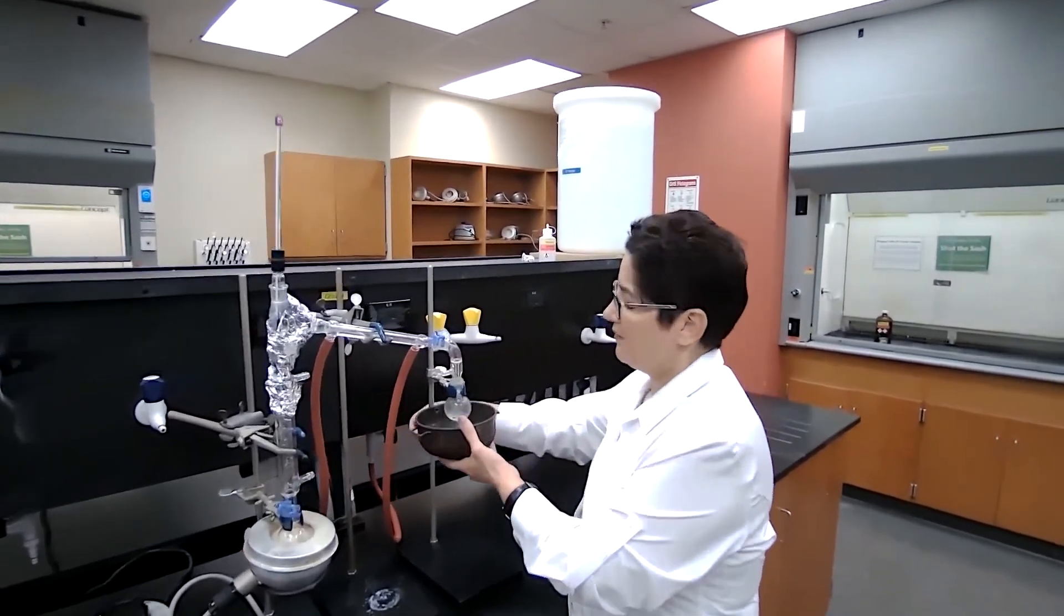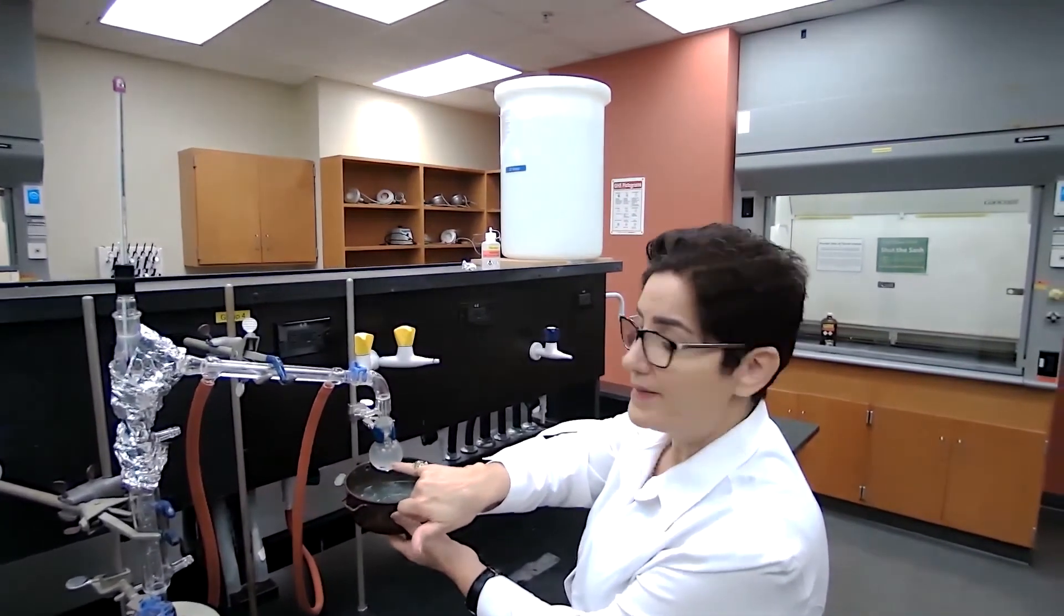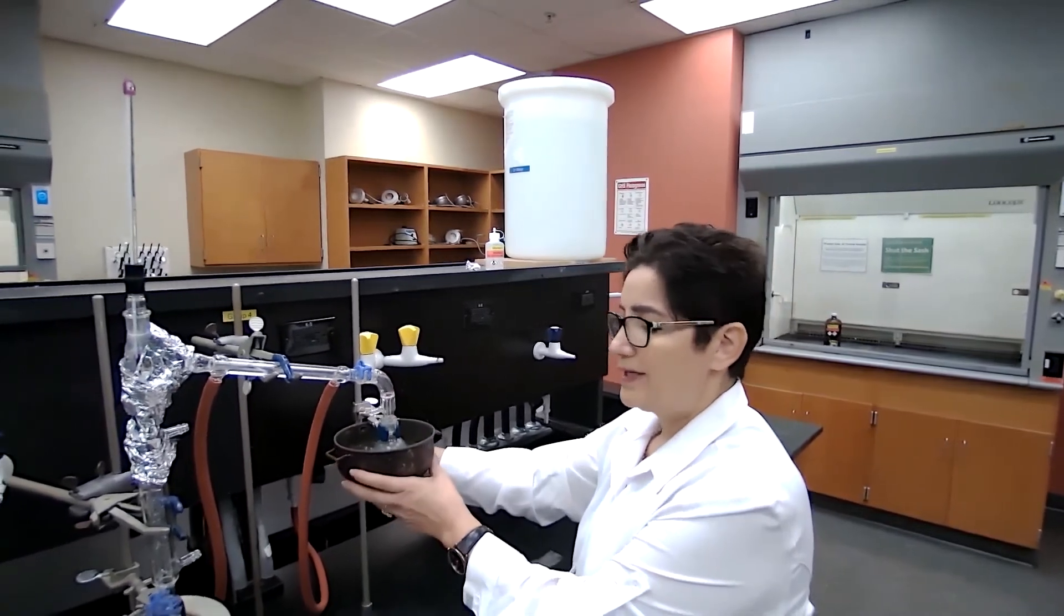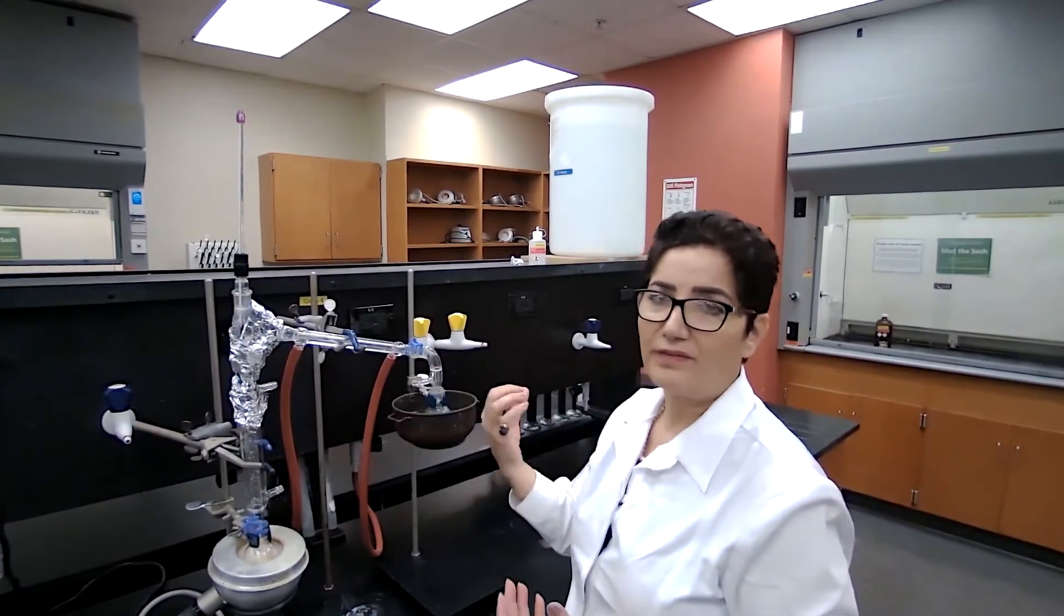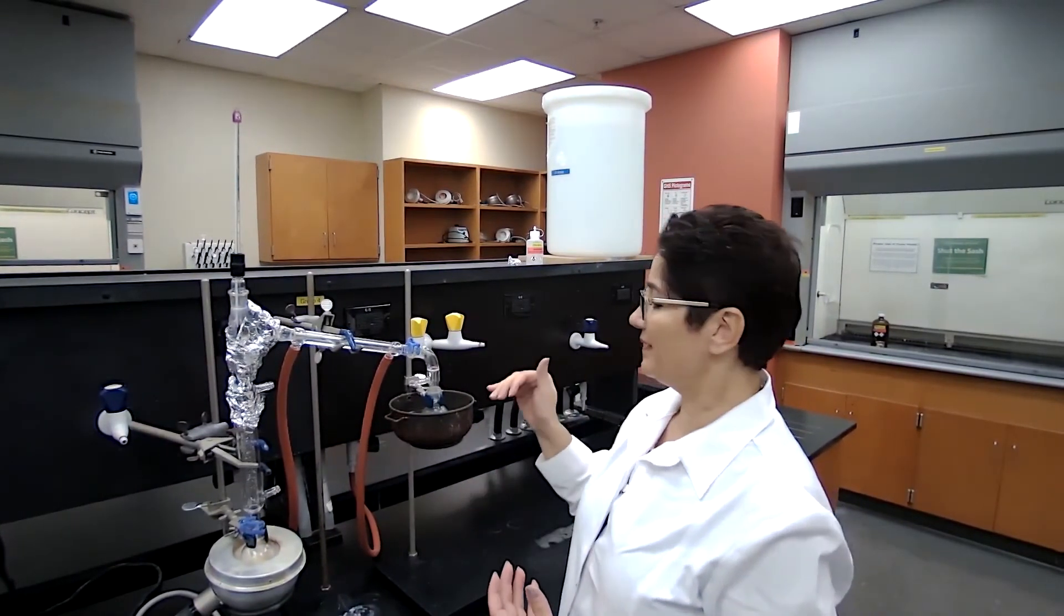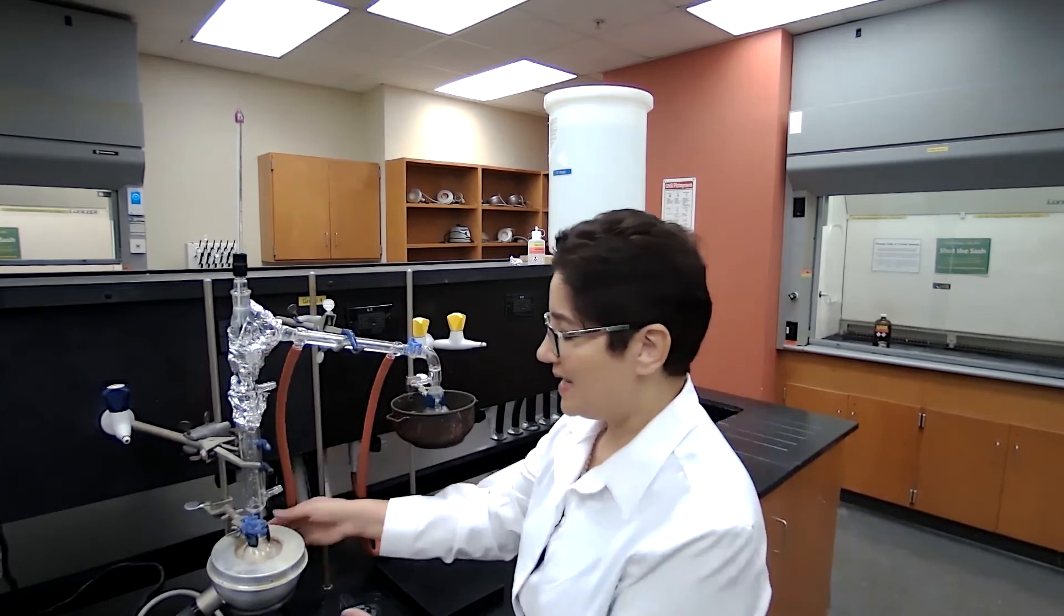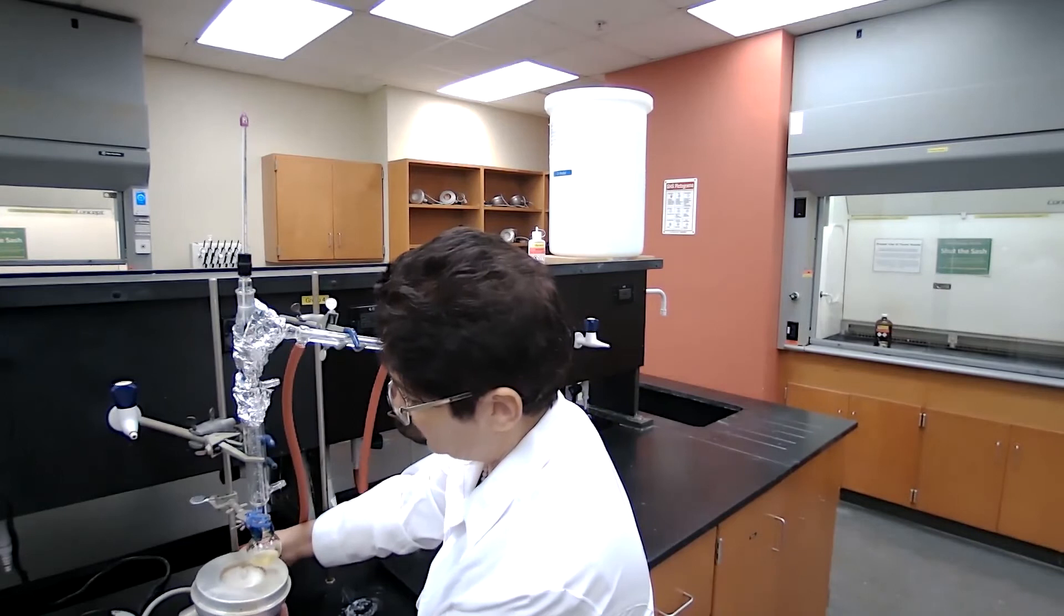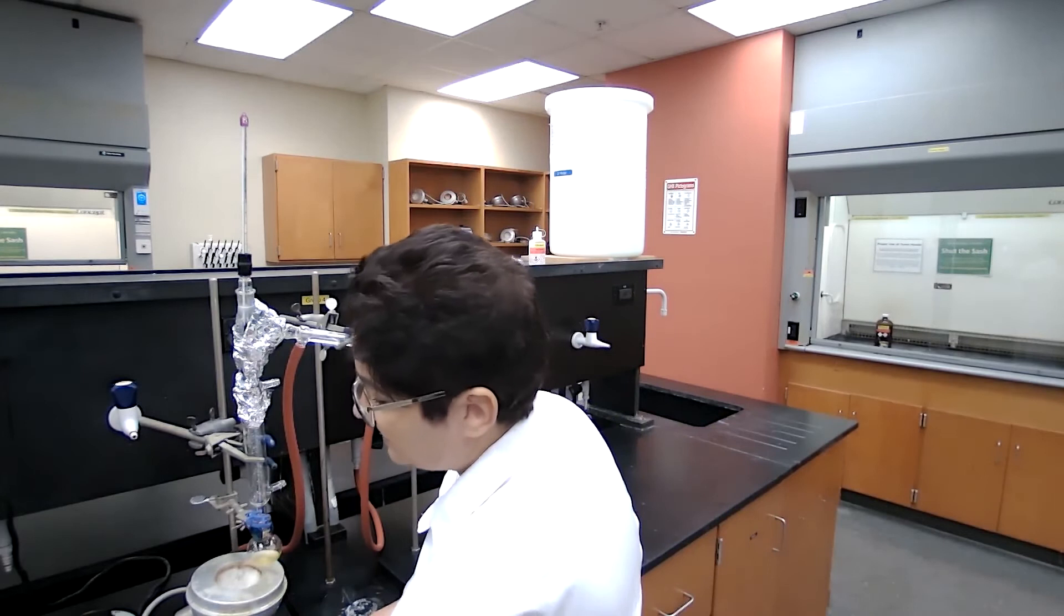We have enough liquid to the mark that we had with the marker, so now I can stop the distillation. That's our desired amount of distillate. There are other cases where we have to stop distillation. If the flask was drying, if there was no liquid in there, that would be an immediate stop of the distillation.